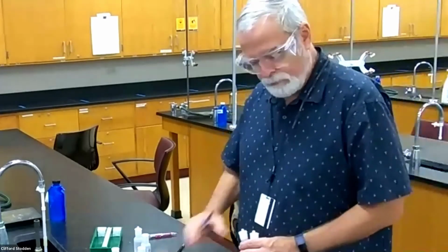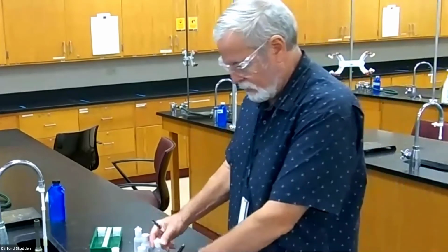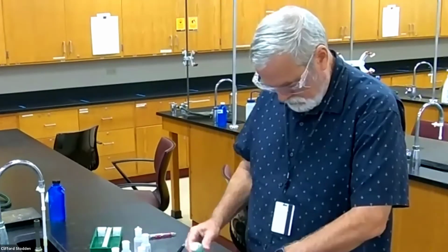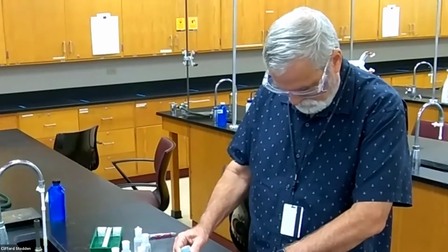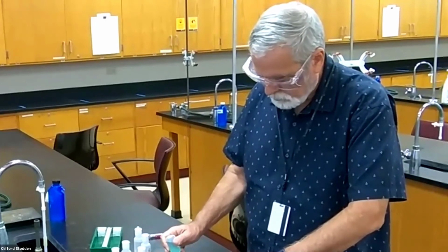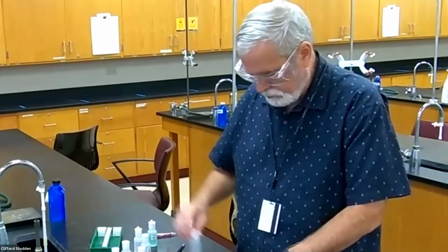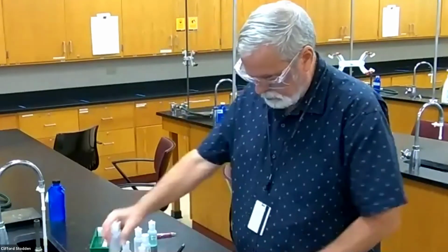We're going to continue with the next one on our table, which is nickel. And again, we've done some of those with the nickel already. I'm going to add nickel all the way across first. Silver nitrate with nickel. And I don't see anything there.